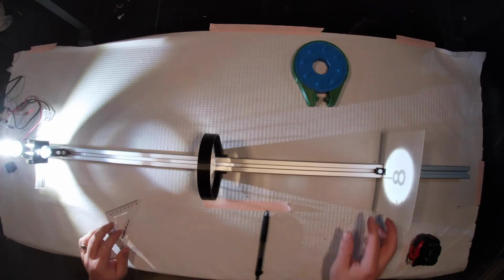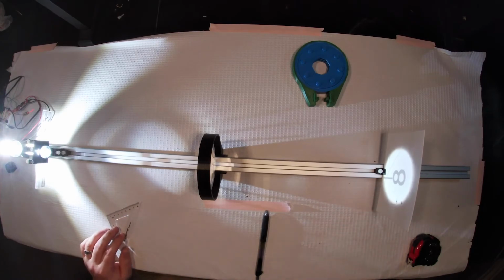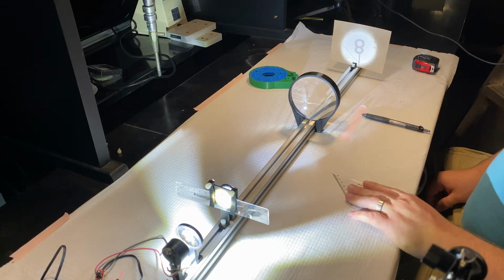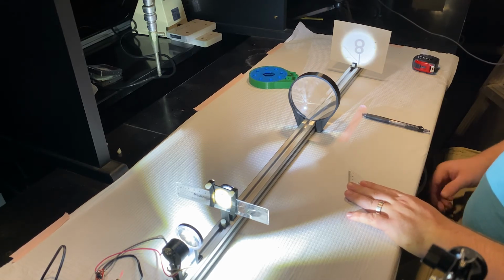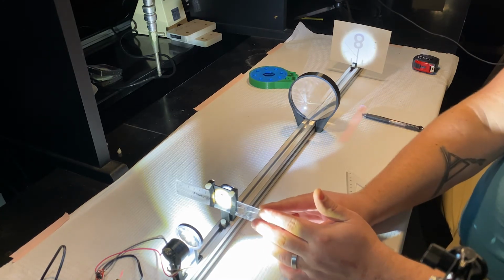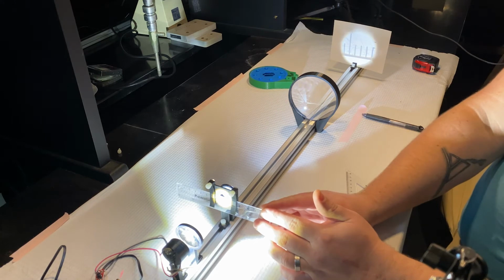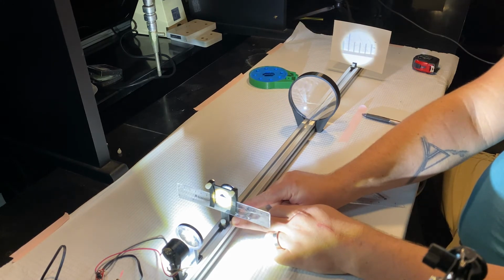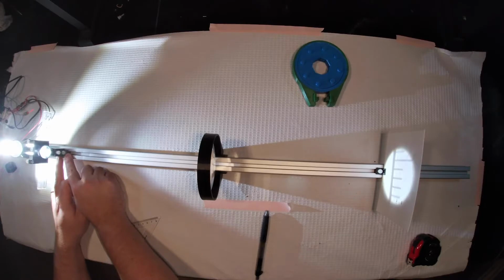All right. So that is about as close to in focus as I think I can get. What we're going to do now is use an empirical measurement to calculate what our magnification is. So I'm just going to move this back so where these little tick marks are visible. And we know that these tick marks represent 1 millimeter each.